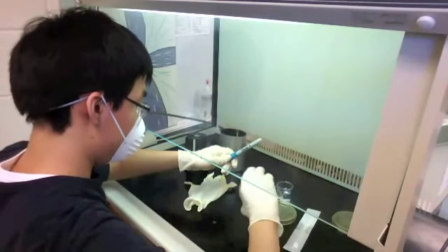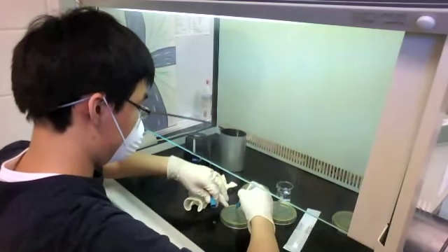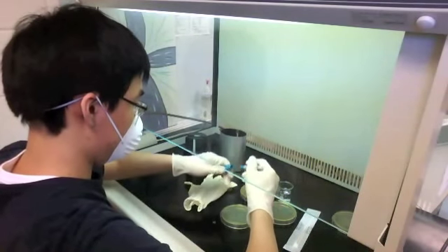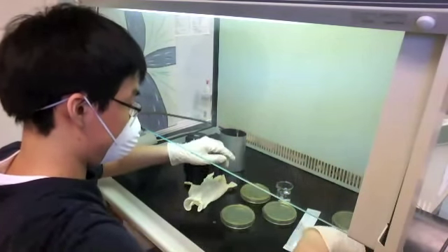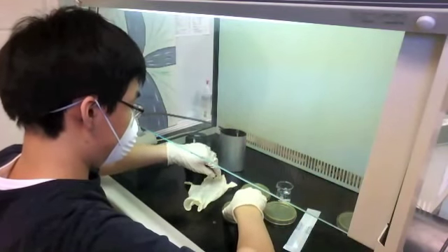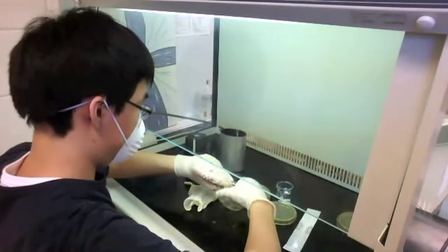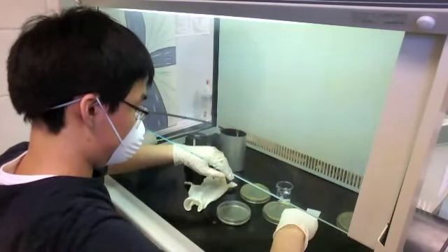I'm moving back a little bit to have more room. I had an extra plate in there, which is why I'm labeling a fourth one, but I only need three. I put four in, so I'm just putting that one aside — the back side — and now I'm looking at the petri dishes and flipping one over so I can plate it.